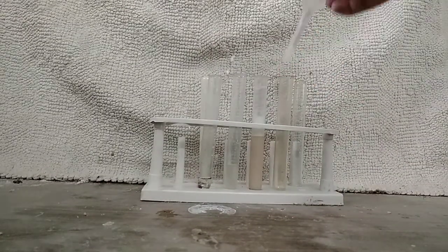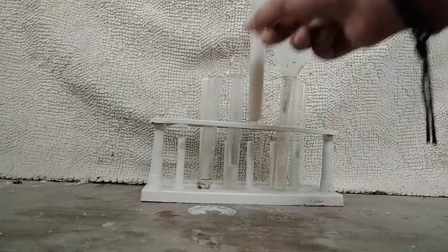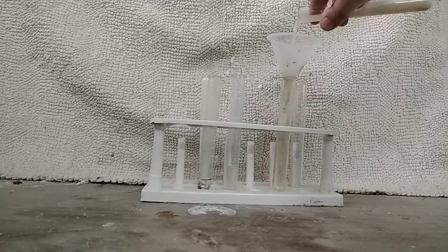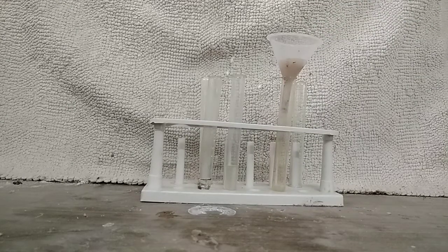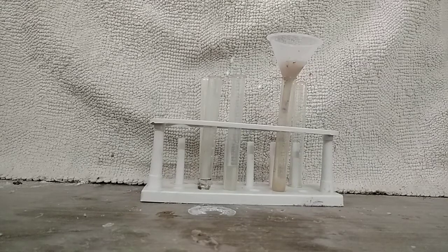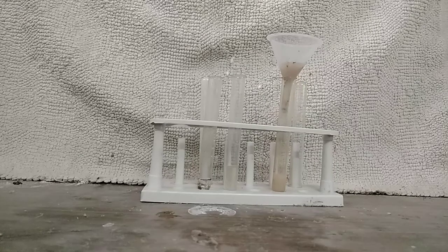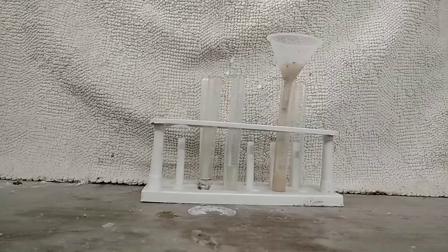We will now filter the solution out. You don't require anything super expensive — you can just use a piece of cotton. I will give it a light mix and put it into the filter funnel, which is fitted with a small piece of cotton. The solution that drips out is known as your soda extract, or the sodium carbonate extract.